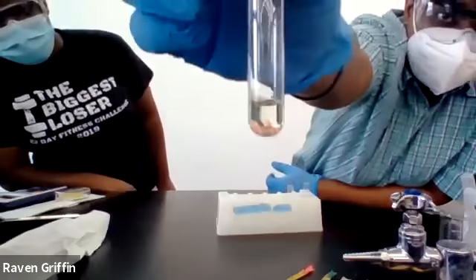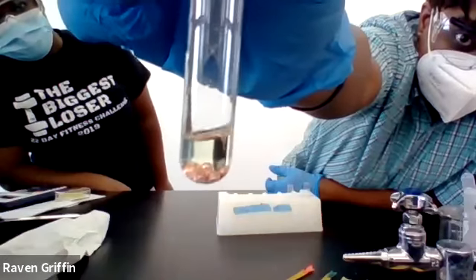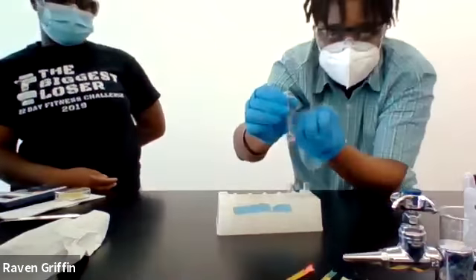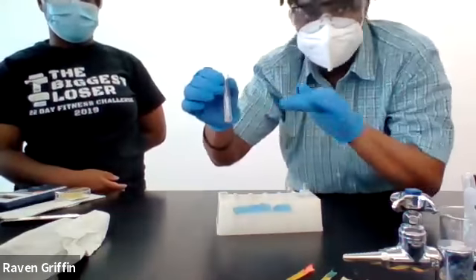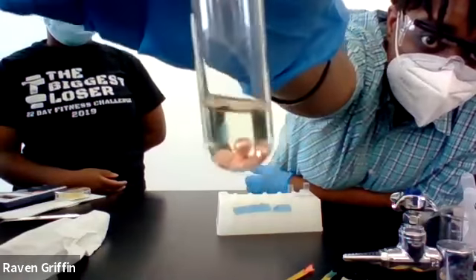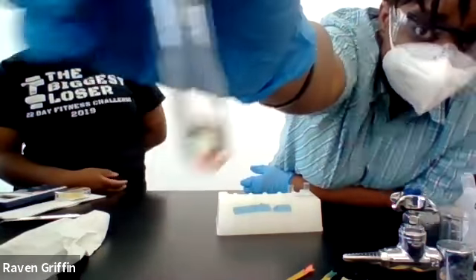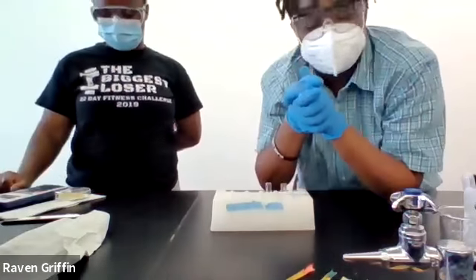And then here's the copper, little copper colored pellets, and they're really not doing anything. They kind of bubbled at first for like a second. Yeah, it's very quick. And then it just stops. No color change and most of the solid is still there. All right, any questions for that part?